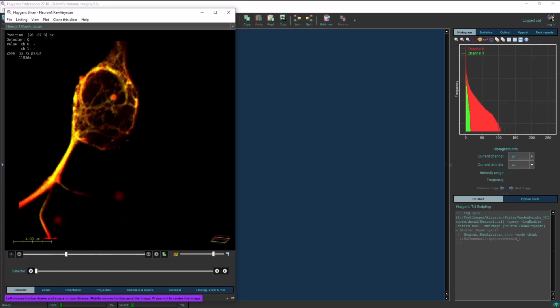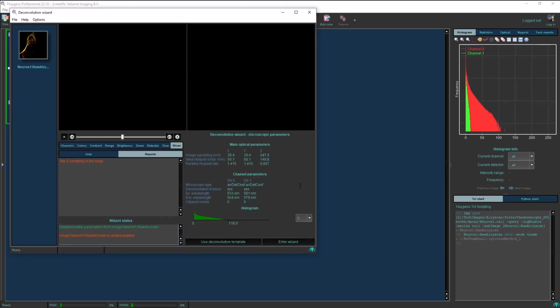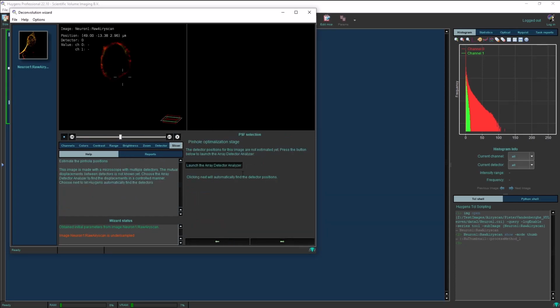So all of the options I just showed you to visualize the intensities have been possible since Huygens version 18.10. However, in the upcoming release, we will show you the Array Detector quality control window that will allow you to see this information more straightforwardly after opening the tool. This tool is available from the Deconvolution wizard, and by clicking through the pre-processing stages in this step-by-step wizard, you arrive at the Array Detector Analyzer stage.